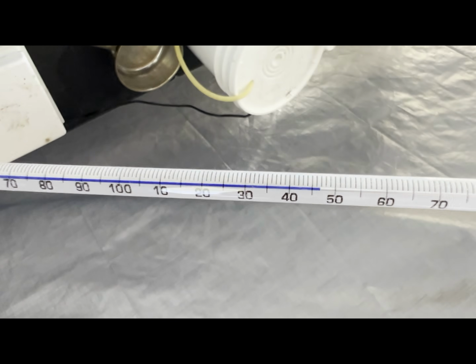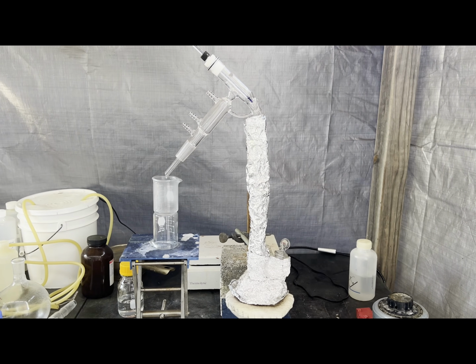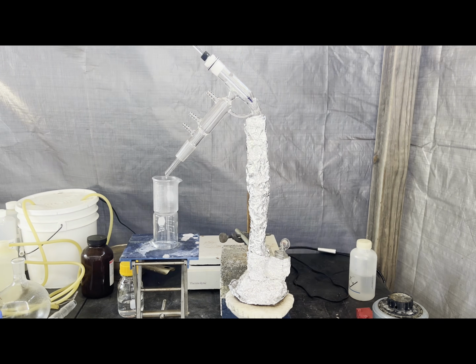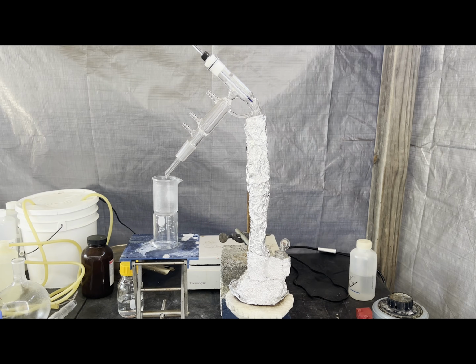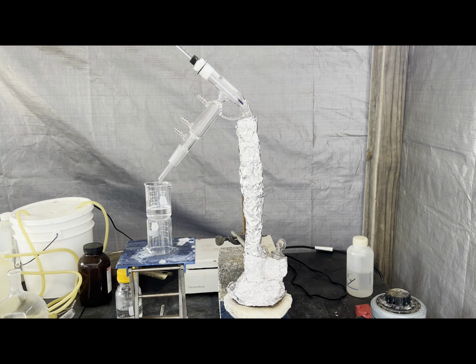In that run, I gradually raised the temperature of the heating mantle, but in this one, I just maxed it out, and the acetic acid came over pretty warm this time. I'm sure I lost some because of this, but acetic acid is cheap for me, so I don't mind. Once the temperature reached 150 degrees, I started collecting the second fraction.